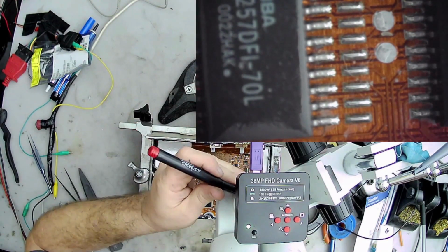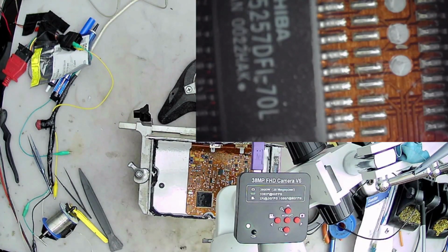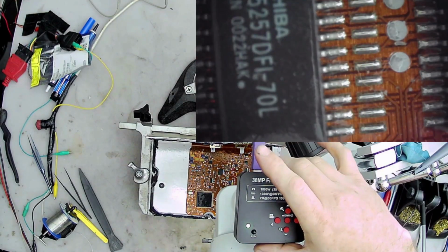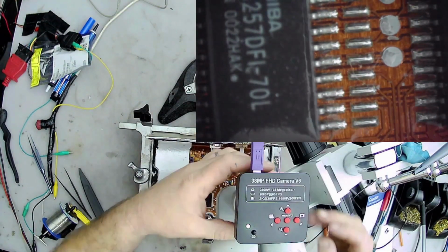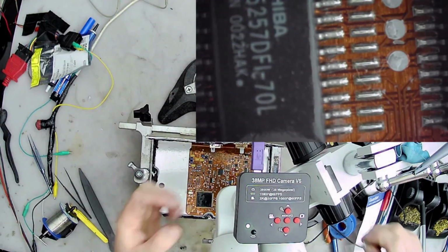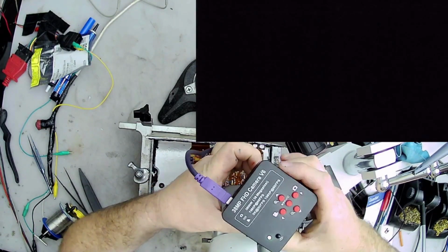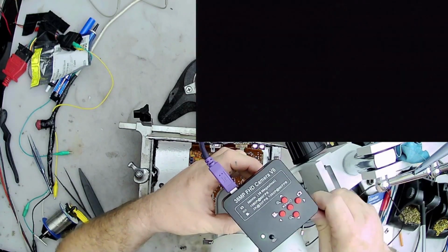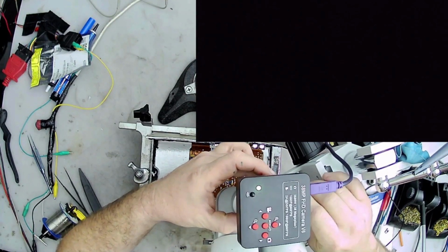And truthfully, you only need to mark two, because you can't leave the case on there to tighten the set screw. So you have to remove one side of the case. So you want to make sure that you have two set screws on one part of the case that you can mark, and then remove one side of the case so that you can tighten up one of the internal set screws. And then once you have that one set screw tightened, you can carefully remove the other case and just tighten the rest. It might not be 100% accurate, but it's pretty easy to get it close enough, I'll say.